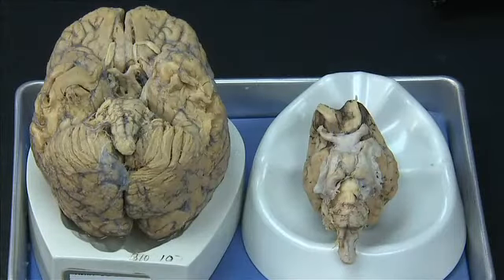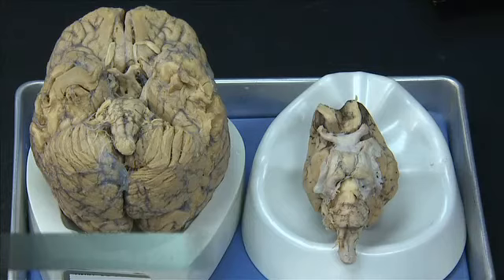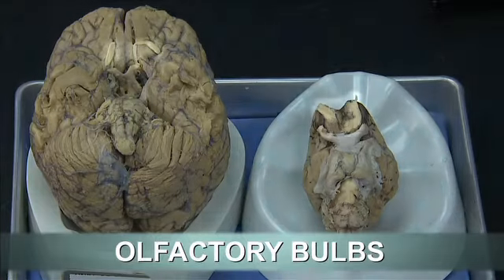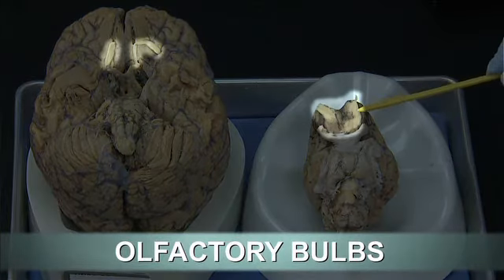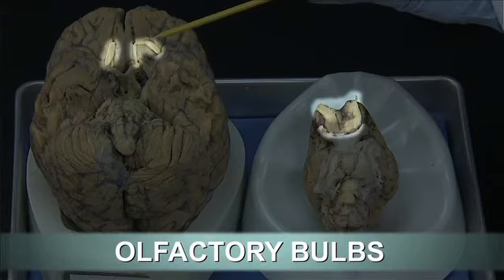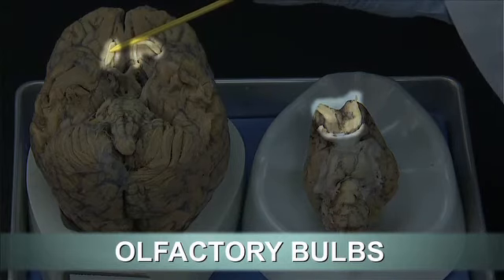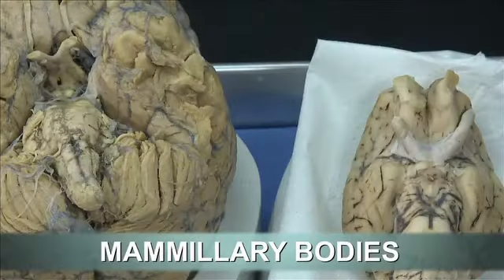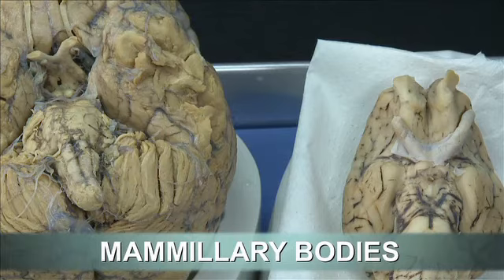The first difference between human and sheep brain is the size of the olfactory bulbs. In the sheep brain, olfactory bulbs are much larger than in the human brain in comparison to the size of the brain. The second difference between human and sheep brains is the mammillary bodies.